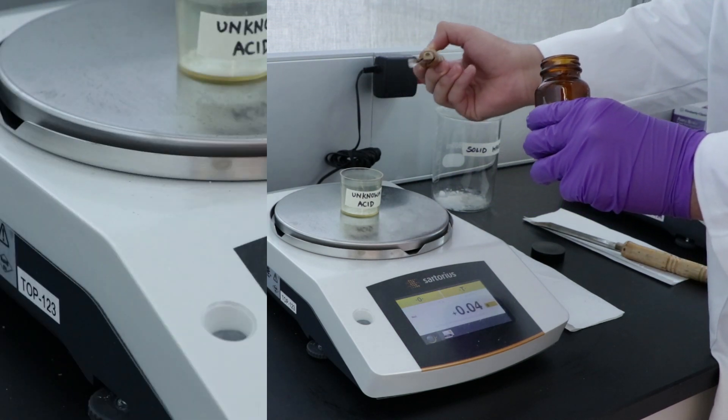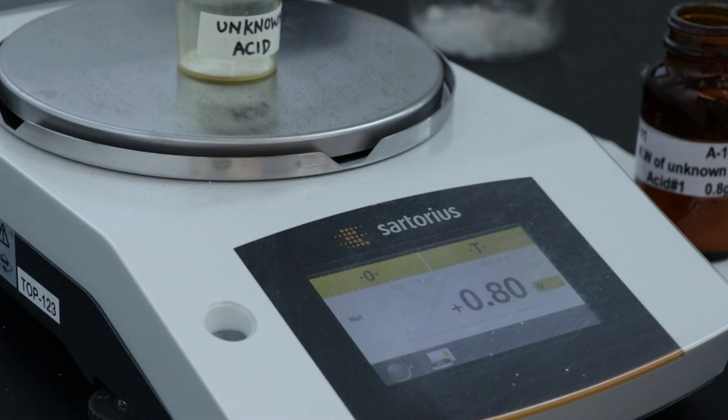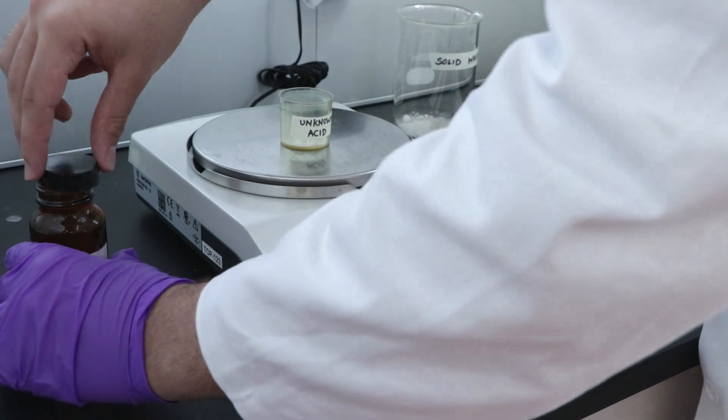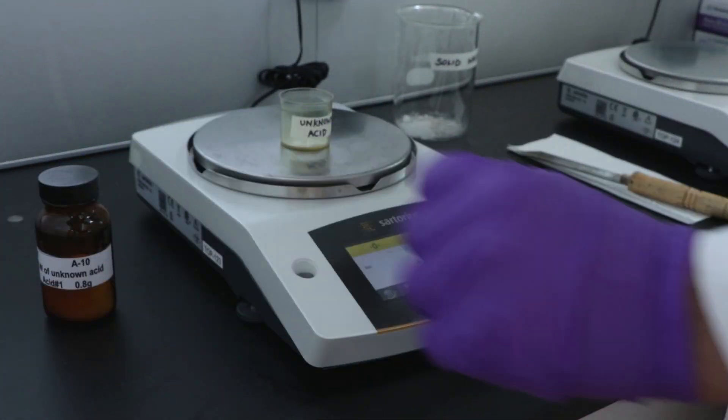Once you weighed out the appropriate amount of unknown acid, you're ready to move to the analytical balances. Please remember to cap the bottle of the unknown acid before leaving the side bench.